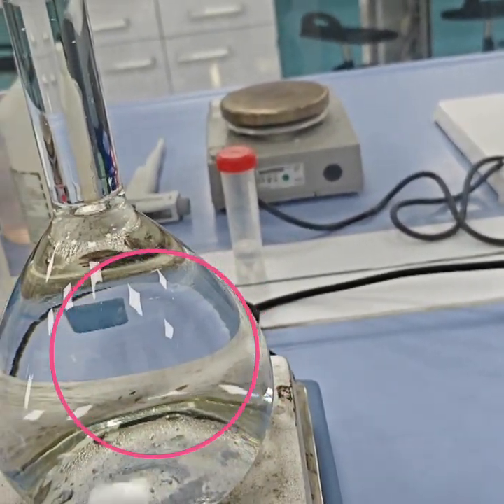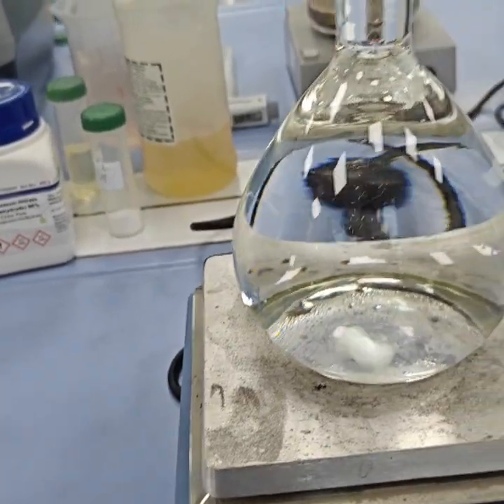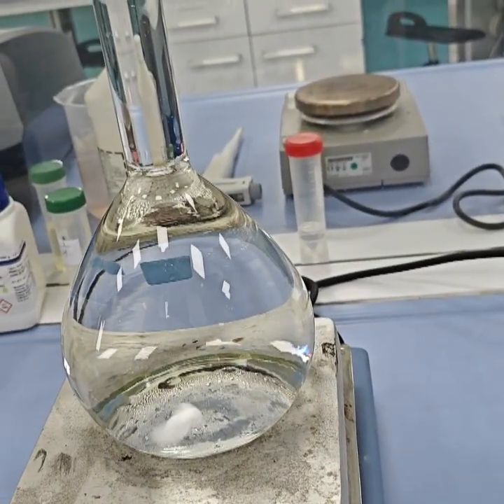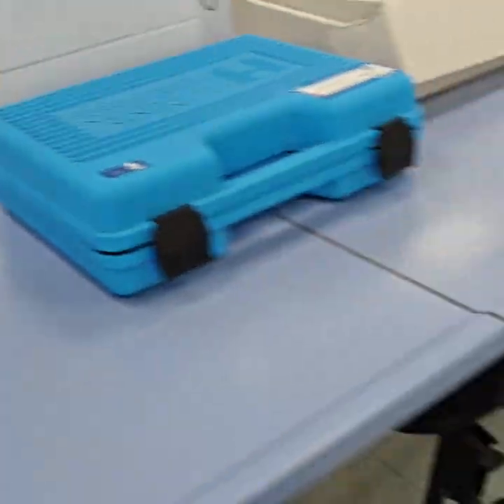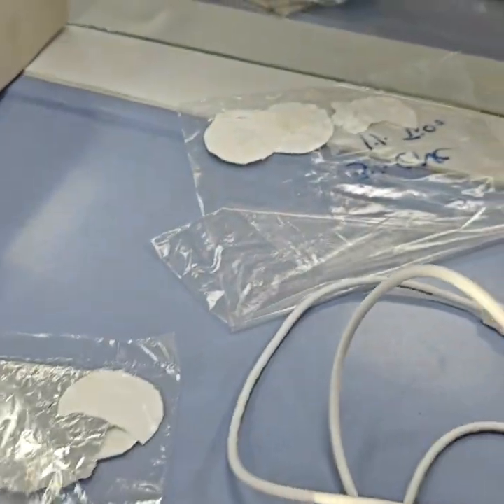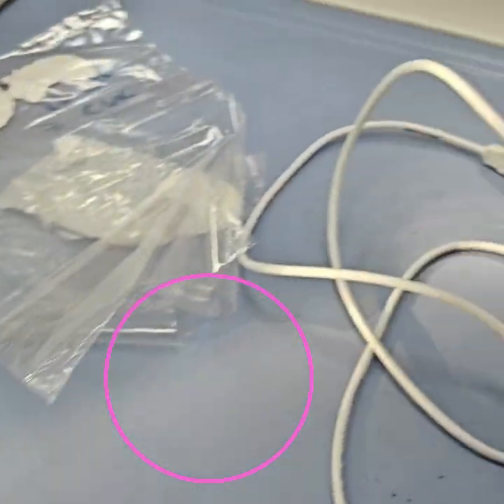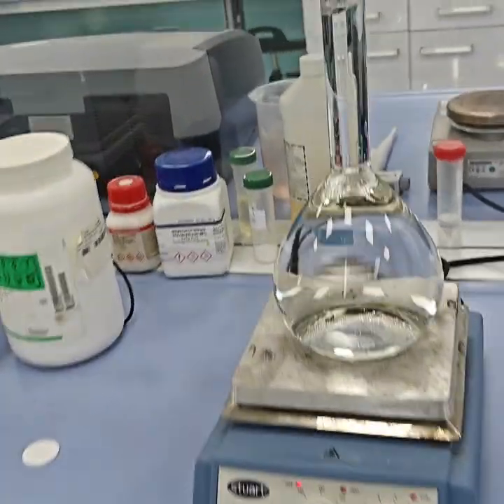adsorbent. Here the adsorbent is our different types of membrane, and usually a membrane can be measured as 10 milligrams, or you can take a piece of 1 to 2 centimeter squares of the membrane. If you see, this is the membrane, so you can take sizes of 1 to 2 centimeter square or 10 milligrams. Okay, now let's start doing the point of zero charge for the membrane.